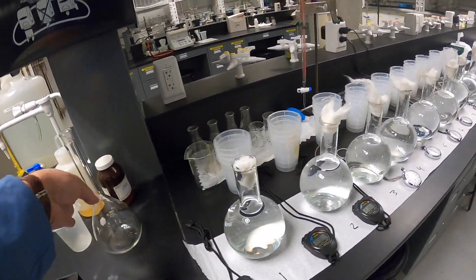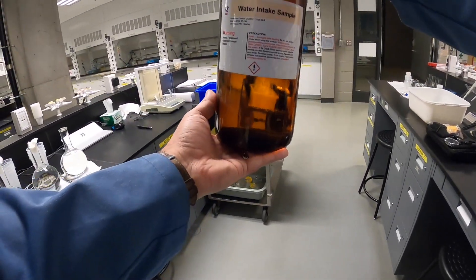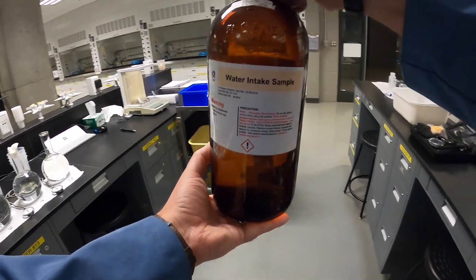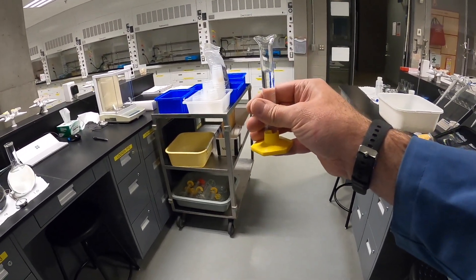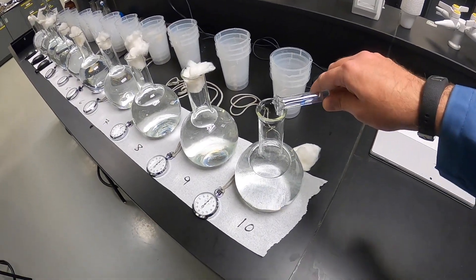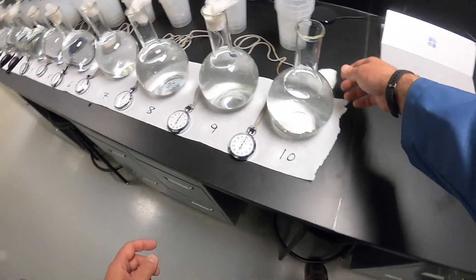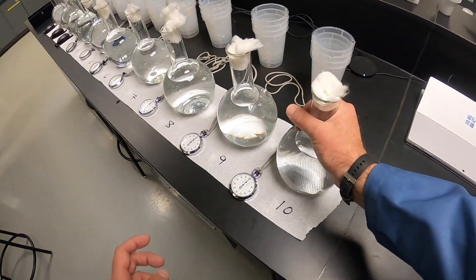We're going to take our raw water intake sample — 10 mL which I've already measured — and pour it into our reactor flask, then put a bit of cotton wool in and give it a shake.